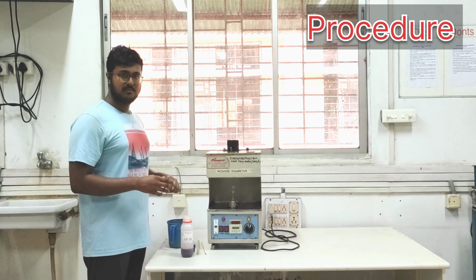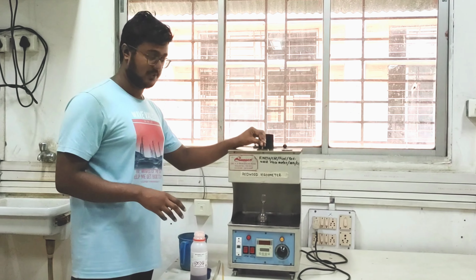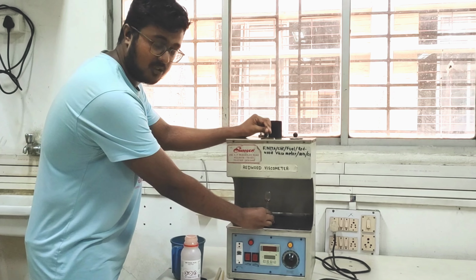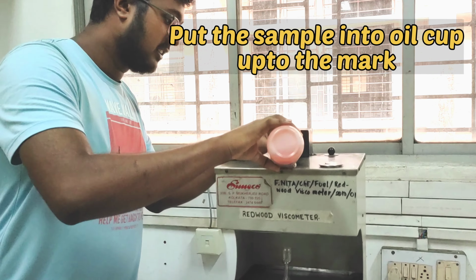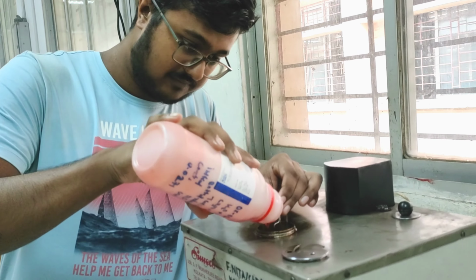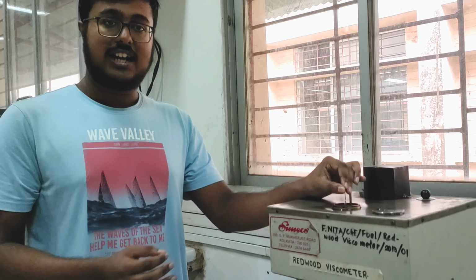We will start the experiment by making sure that the ball valve is completely filling up the orifice opening and that the measuring flask is directly below the orifice opening. First, we will pour the lubricating oil until the pointer is completely submerged, and then the first reading will be taken at room temperature.